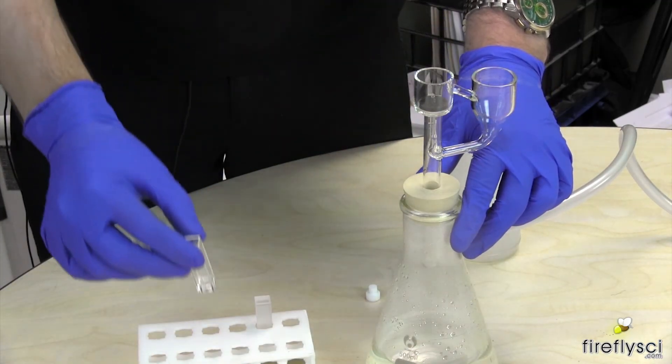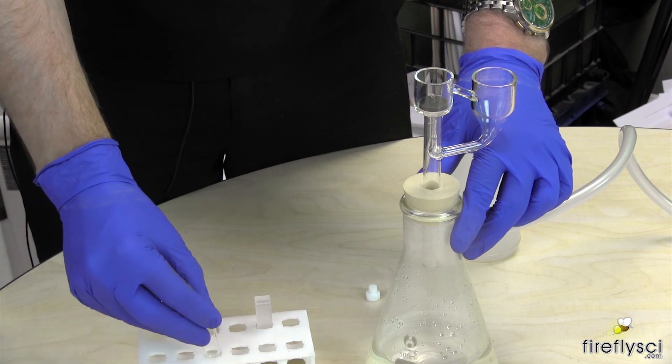Now I'm going to lift off my cuvette, put it upside down in the cuvette rack to air dry.